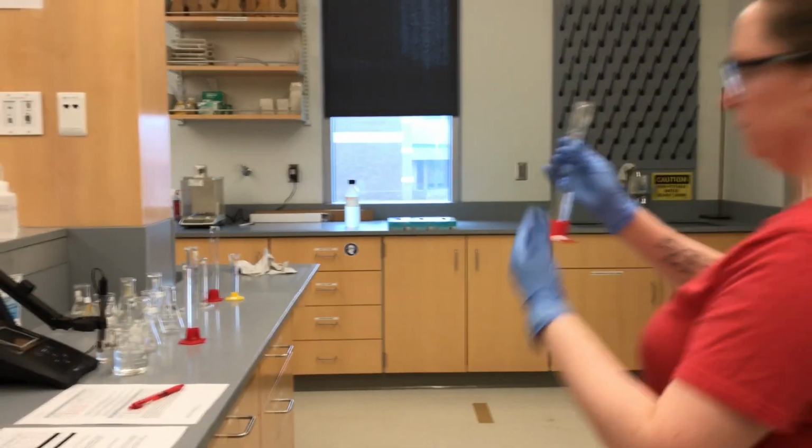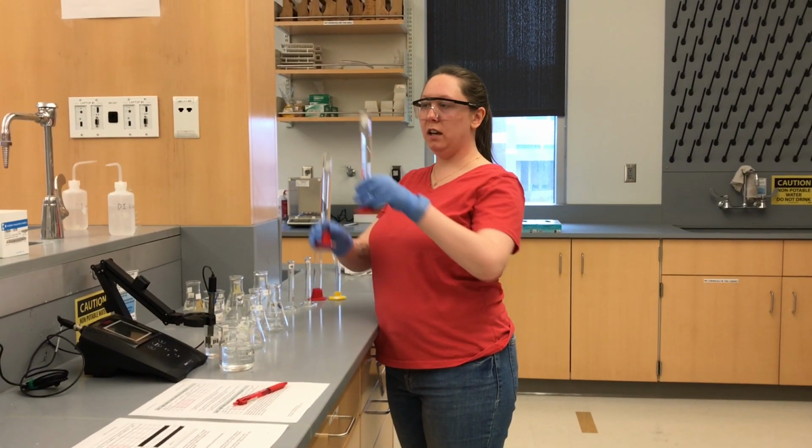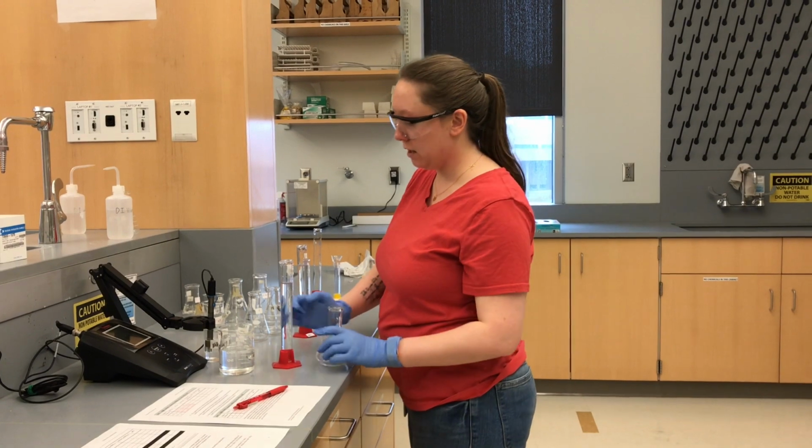Okay, so I have 50 mils of our HA, 50 mils of A minus. So I'm pouring that in here to make E.